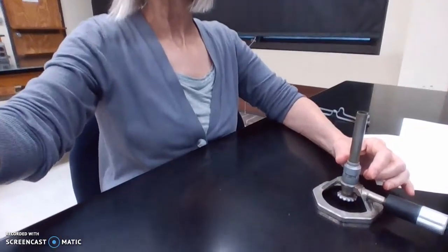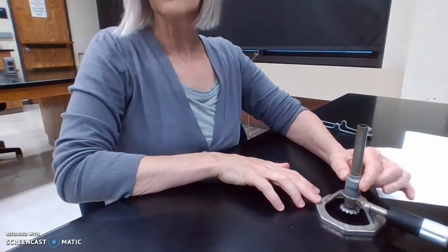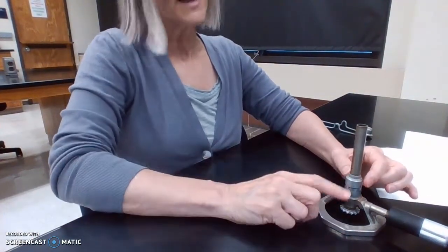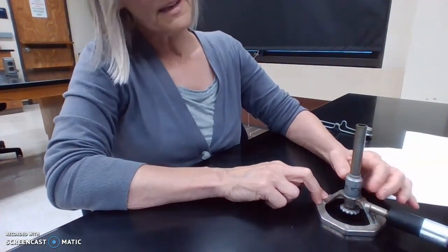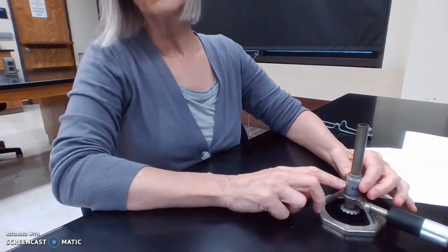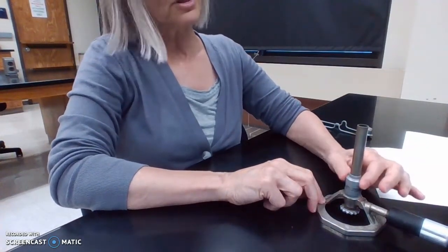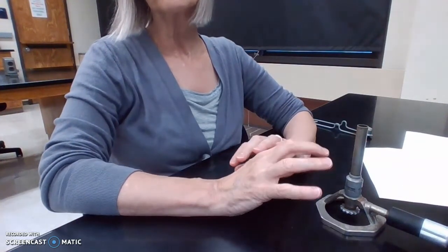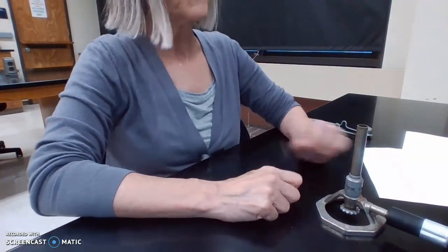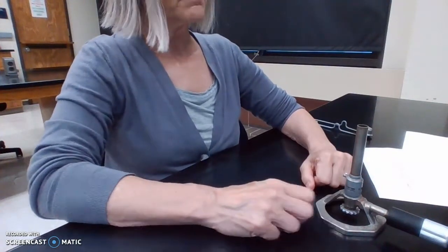The other parts that are critical are the air ports, and you'll notice right here, I can screw this collar area or unscrew it, and I open and close it so I get a space in there. The more open it is, the bigger the space, and the more air goes in there. The more closed, the less air. And the amount of air is going to help affect the quality of our flame. And those are the main parts you want to know.